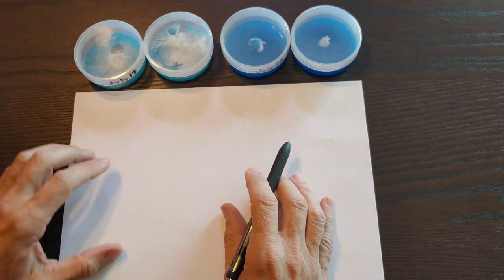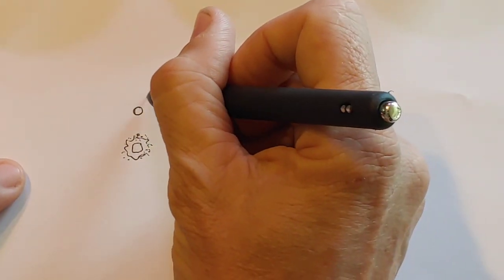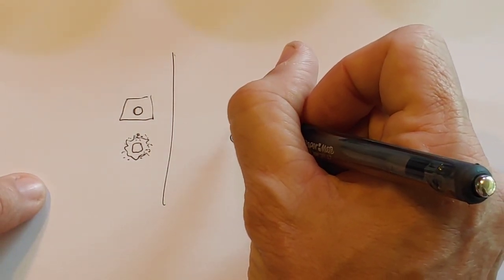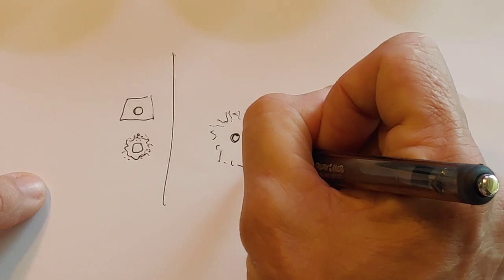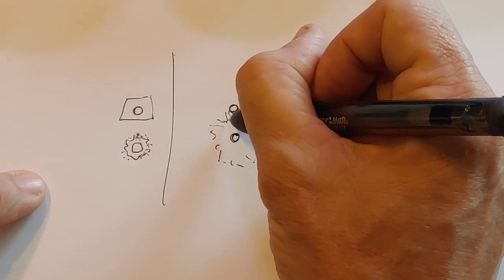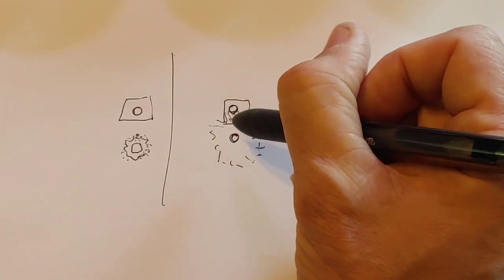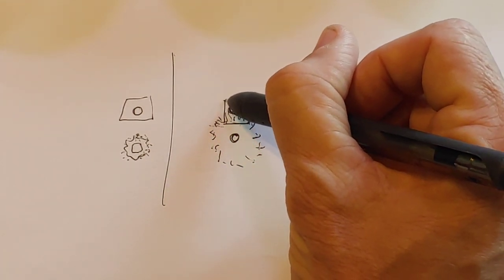Let me explain. We had the contamination here. It was a spot like that big in comparison. It was pretty far away, so I cut away here. Now, let's say that this is our tissue. And the contamination was here. It's very risky to cut this out, because it already touched the mycelium. So it may have already contaminated farther down than you can see or that you can tell. So if the mycelium is touching the contamination blotch, I wouldn't have done that.